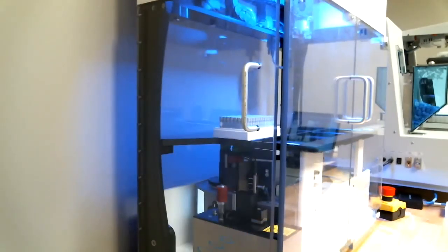Another thing that I wanted to mention is label sizes. We do offer a variety of different label sizes for different size tubes. They can be made with a wraparound so that there's no chance at all of the labels peeling off. You shouldn't have that at all to begin with, though. The labels are chemical and abrasion resistant. They're temperature resistant, down to liquid nitrogen storage. And as long as you're not using anything more than like 70% ethanol solution, you're not going to have any issues with your labels at all.